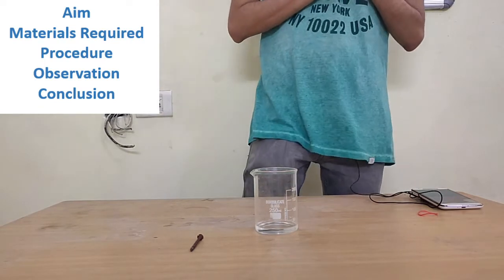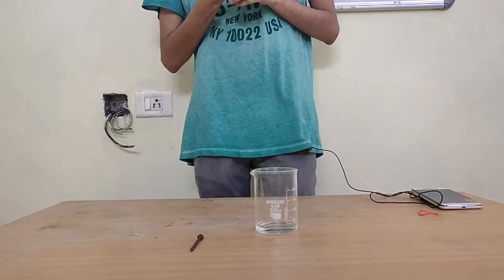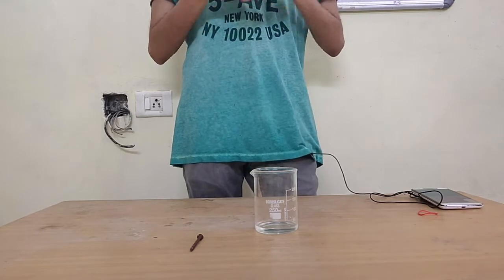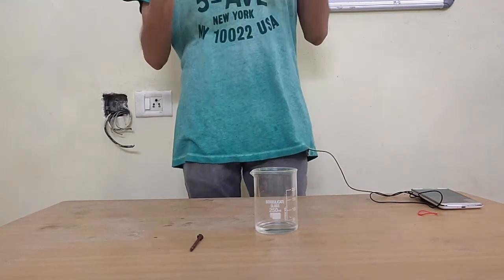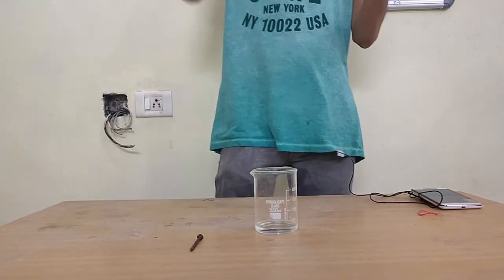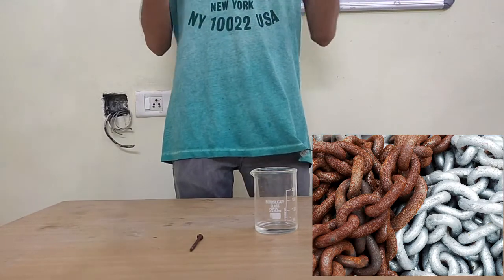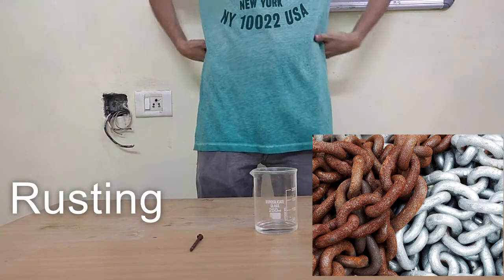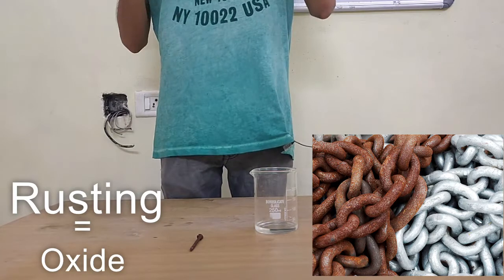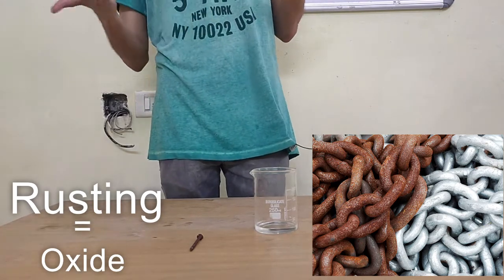So for today's activity, we are going to be using an acid to look at something called a metal oxide, and how a metal oxide can interact with an acid. Metal oxides are actually commonly found in nature. Whenever we have something made of iron or a metal and keep it out in the open, a couple of days, weeks, months later, it starts to rust. Especially iron will rust. Different metals have different types of oxidation. For iron, it is called rusting. So this rust is actually an oxide. The oxygen in the air reacts with the metal and forms a compound of metal and oxygen, metal oxide, as simple as that.